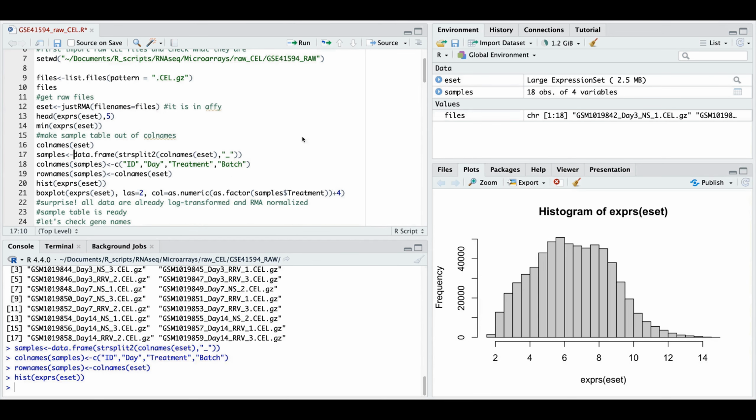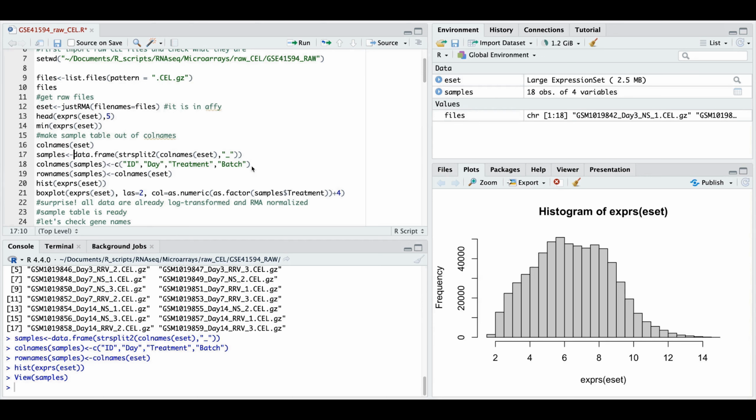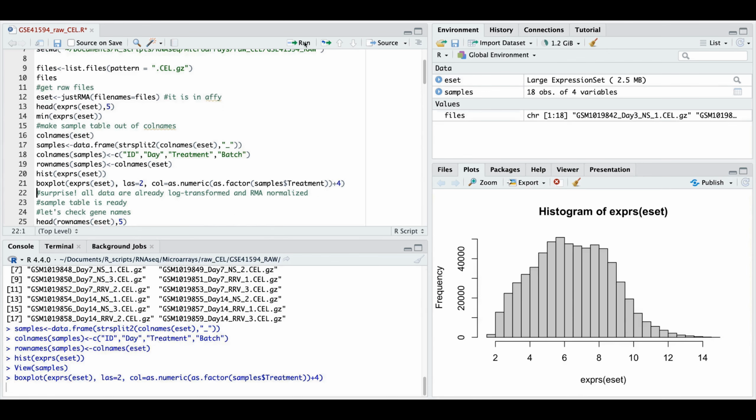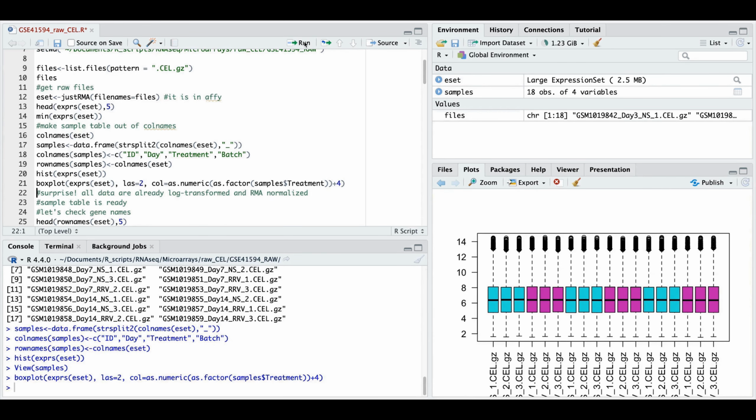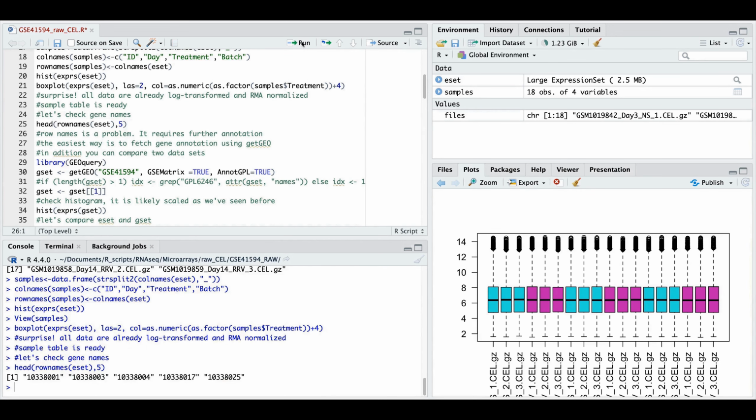a nice table where everything is clear: the batch, the treatment, and the day. And we give all these names to the samples. Now, when we do a histogram, we see that the data are log transformed, and the box plot reveals that the samples are already normalized.